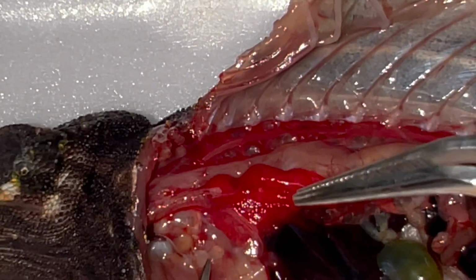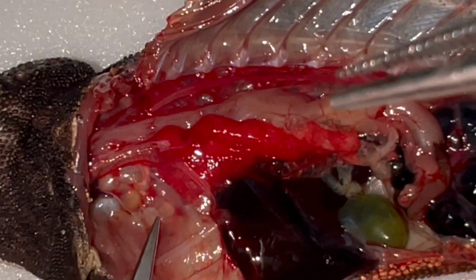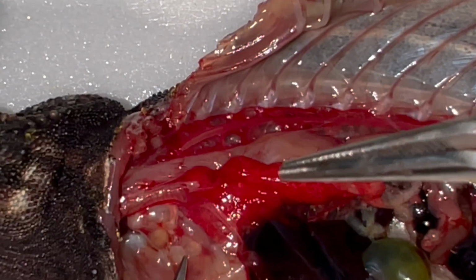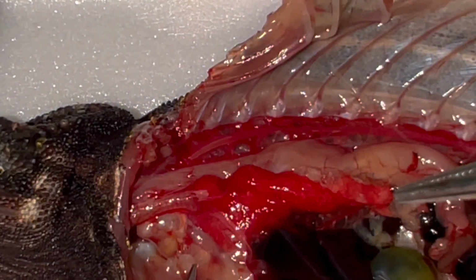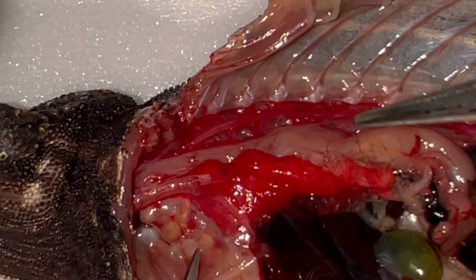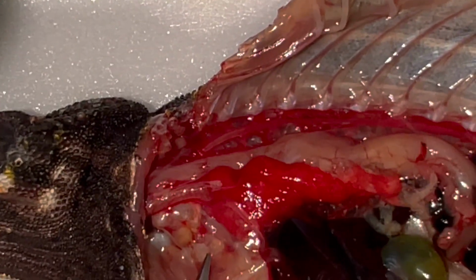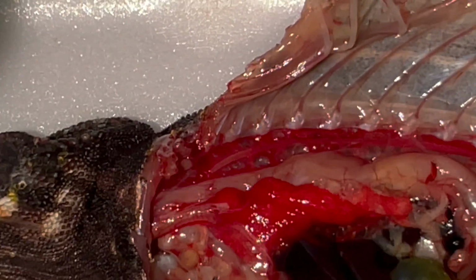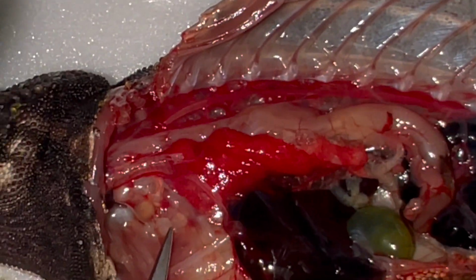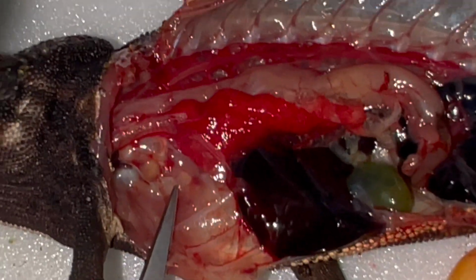However, it does not blow on and off like we are used to from mammals, but it blows on and off only a little. The rest is done by the pulmonary sacs, which pass the air through these smallish lungs to the body cavity, and on the way back it can again deliver oxygen to the circulatory system.